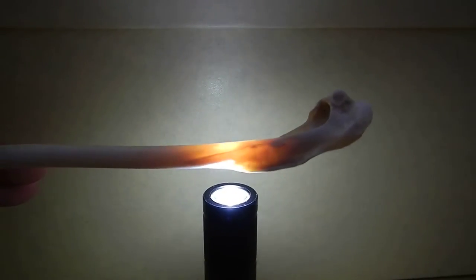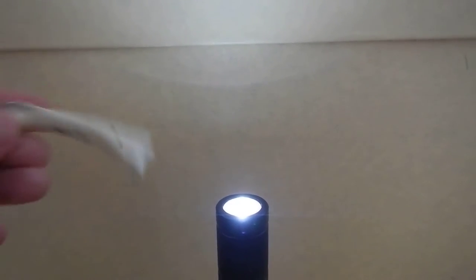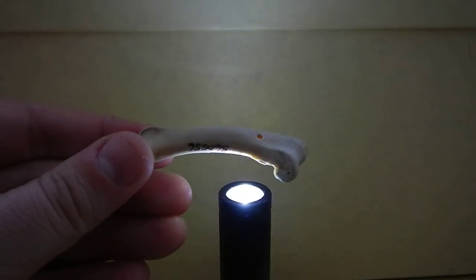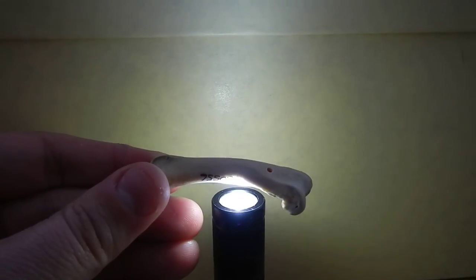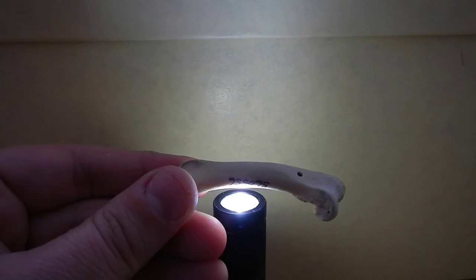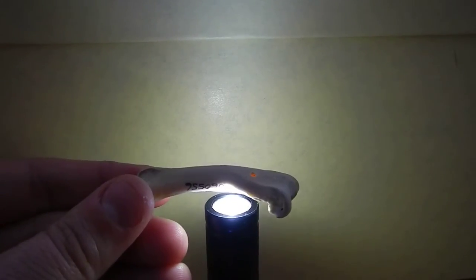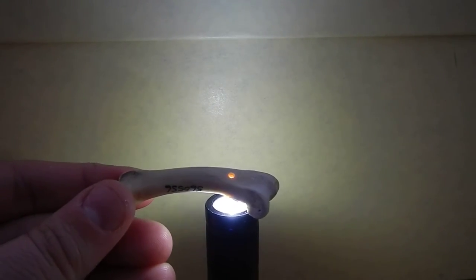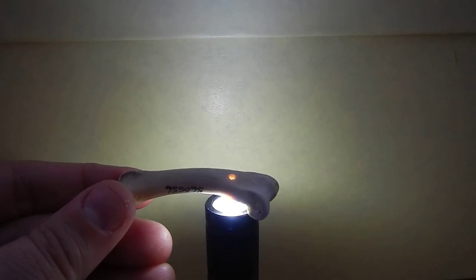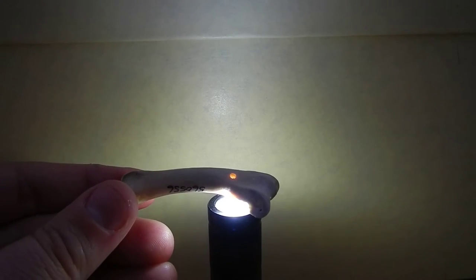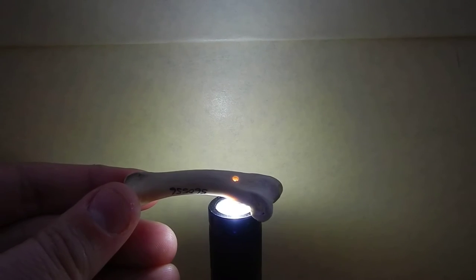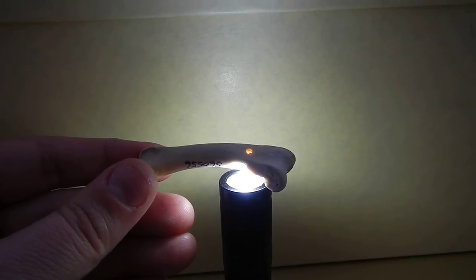If you compare that to a bone that is full of medullary bone, like a femur, when you hold a femur over the candle or whatever your light source is, you can see that it's totally opaque. It's not glowing at all. And that's because it's filled pretty much completely full. The only time you might get a glow is right over here, over that hole where it's drilled to let marrow out during preparation of the skeleton.